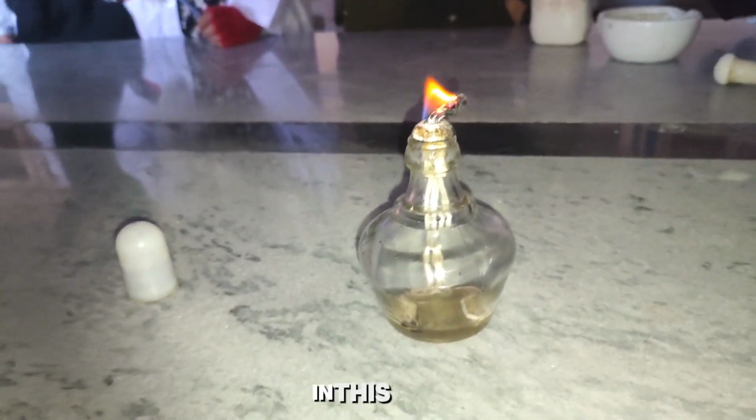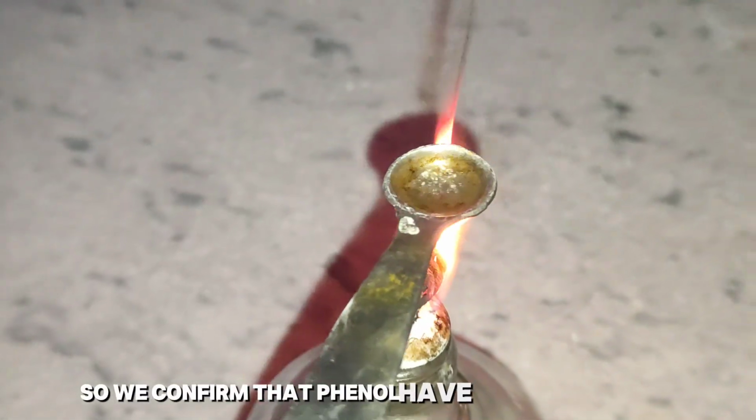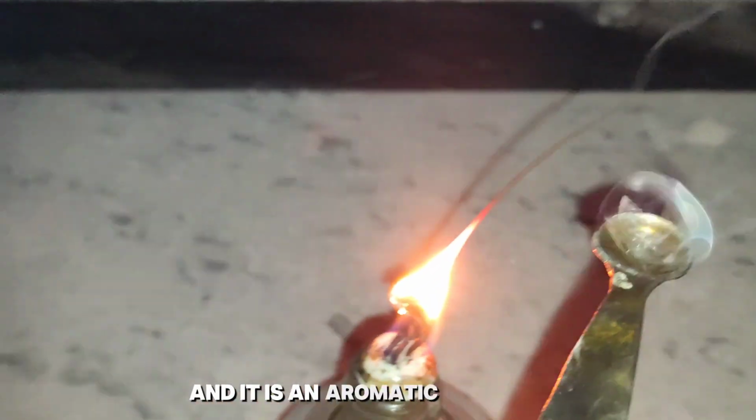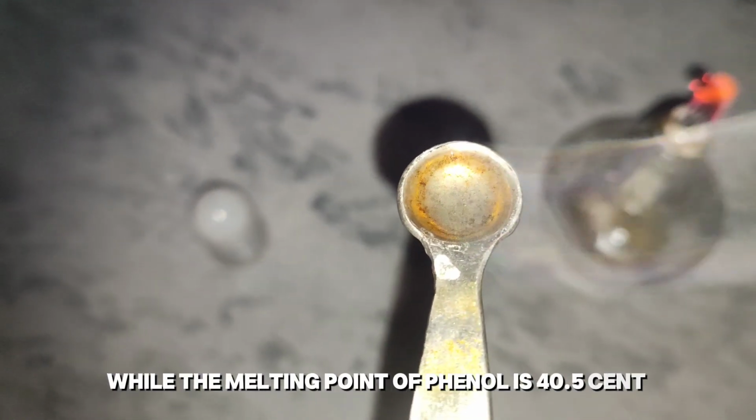Now moving on, the next is called the ignition test. In this test we take a small amount of phenol on a spatula and hold it over a sooty flame. You can observe that phenol melts slowly. So we confirm that phenol has an aromatic nature and it is an aromatic compound. The melting point of phenol is 40.5 centigrade.